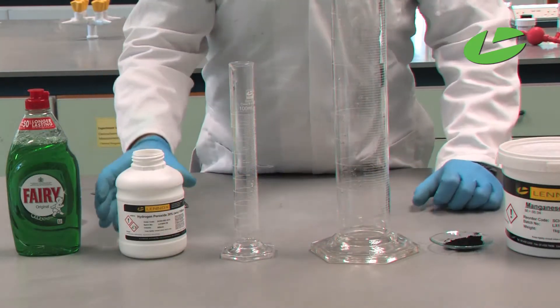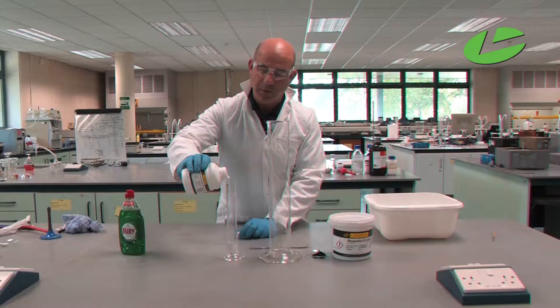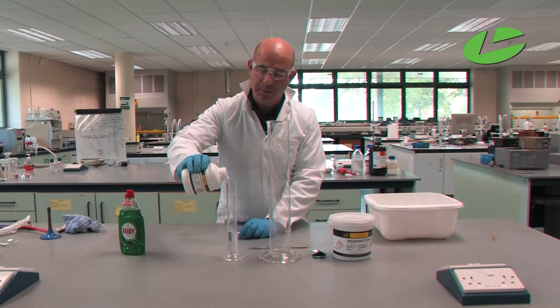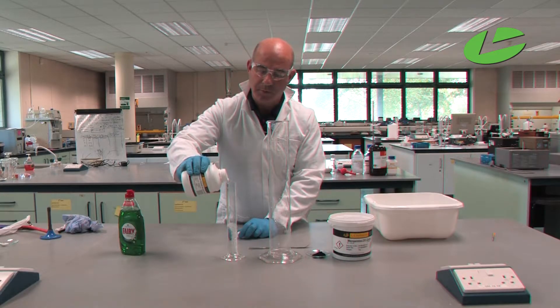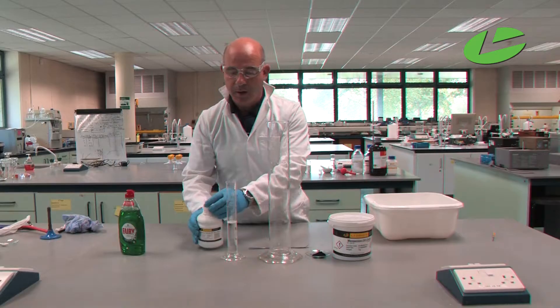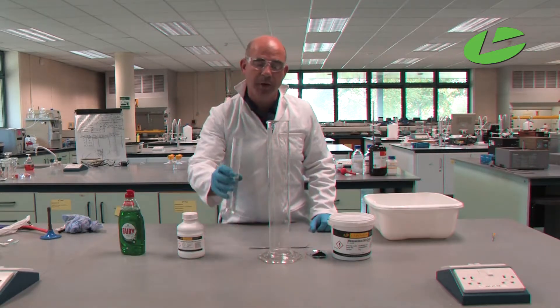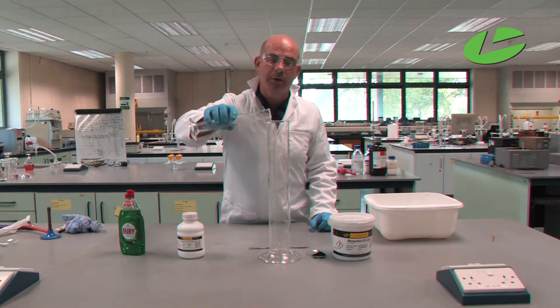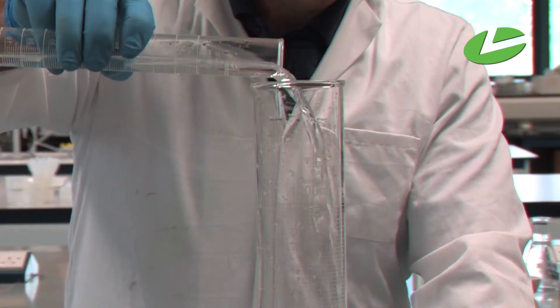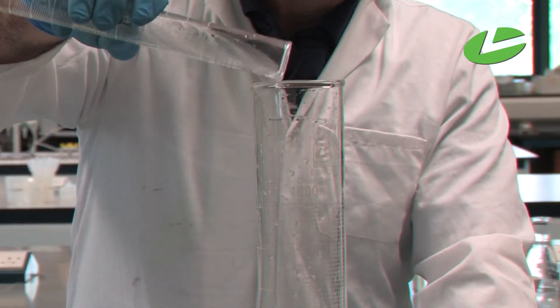The amount of hydrogen peroxide we need is 50 cm cubed. I'm going to put that into the graduated cylinder where the reaction is going to take place.